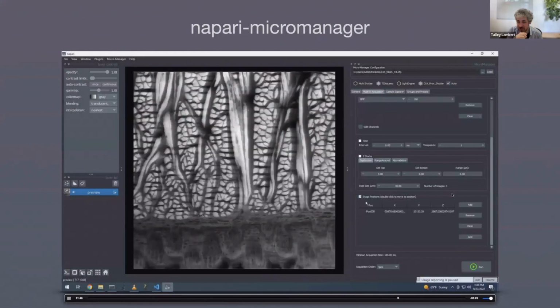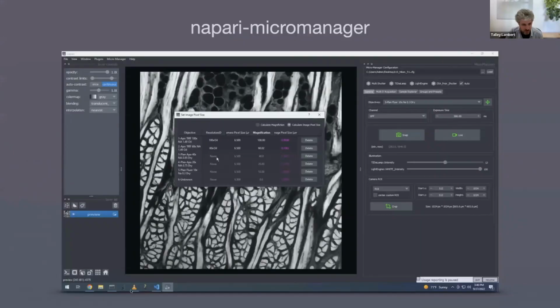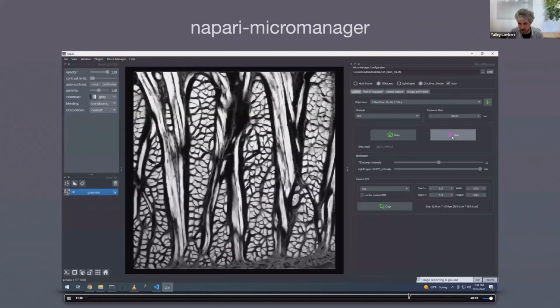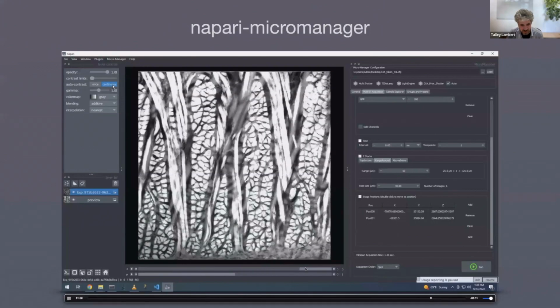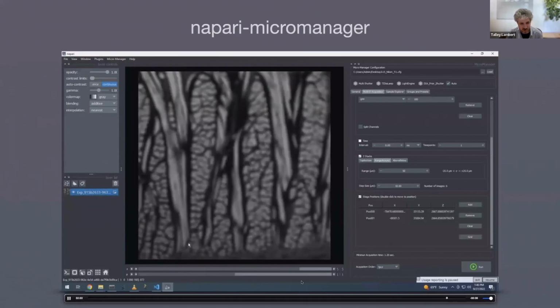This is setting up a multidimensional acquisition. This is an old GUI, but here he's setting up a couple points. So he's made 2 points in the, let me pause. Yeah, so add a point, add another point, and go up to Z stack, add a Z stack. And now as we hit run, you can see that the Napari window has made a new layer called experiment whatever, and is populating your various dimensions with the dimensions of your multidimensional position.